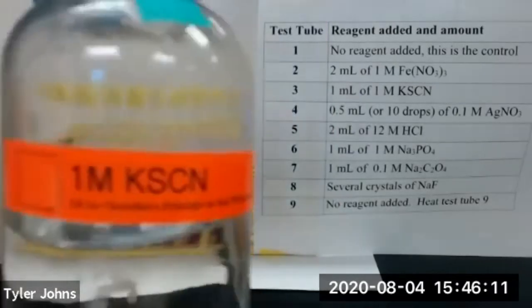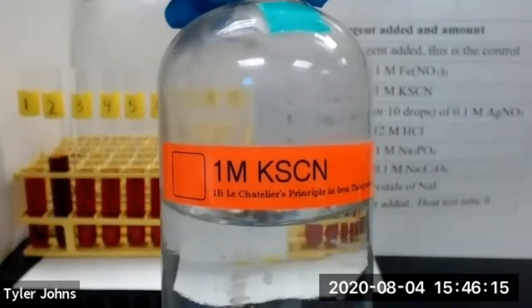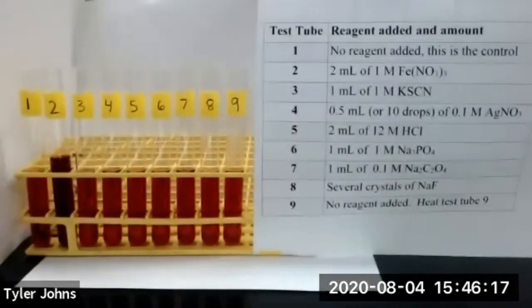We'll next add one milliliter of one molar potassium thiocyanate to test tube number three.